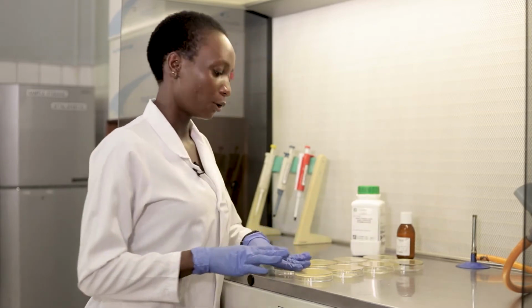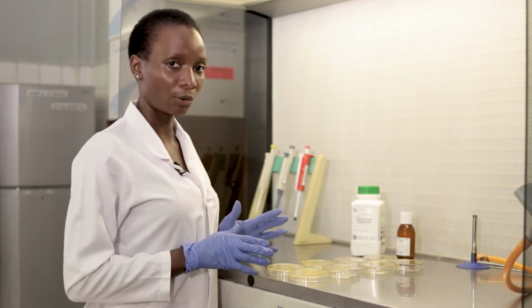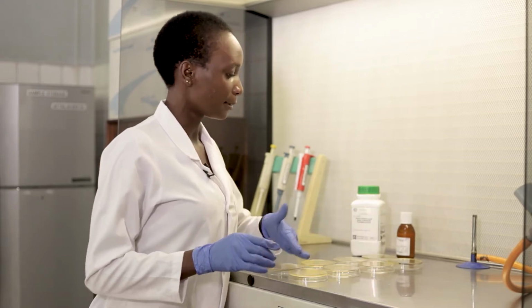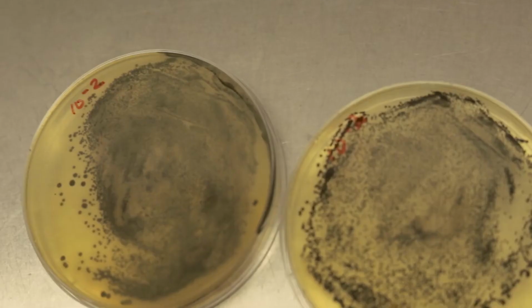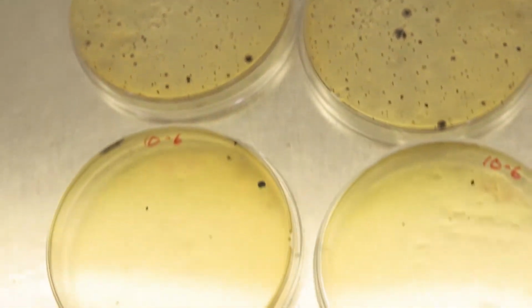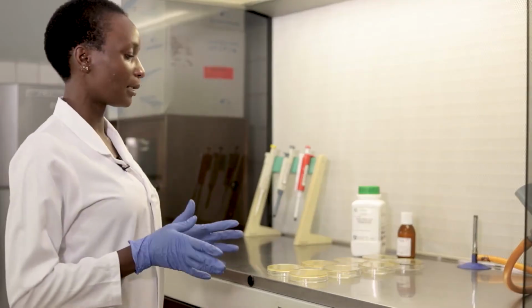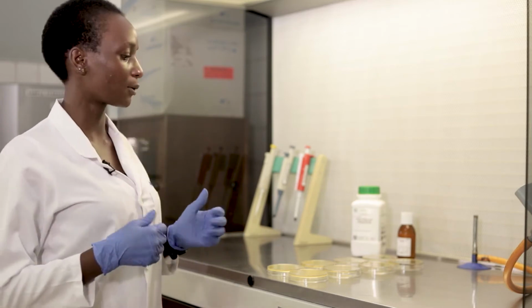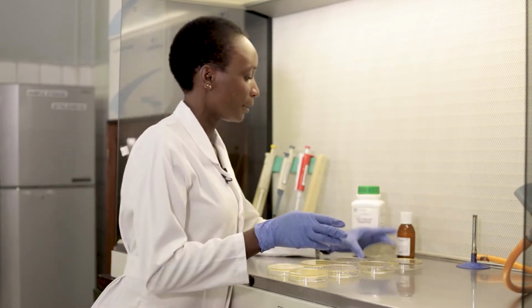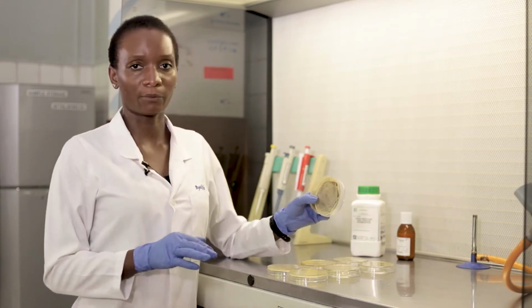So in that technique, you will remember that we analyze at least 3 dilutions from the serial dilutions, and we plate them, okay? So in this case, we have the -2, the -4, -6, and -8 dilutions. And like we mentioned that time, the number of dilutions doesn't really matter. What we're interested in are plates or dilutions that will give us colonies that are countable, preferably in the range of 30 to 300. So as we can see here, at the -2 dilution, we have an overgrowth.